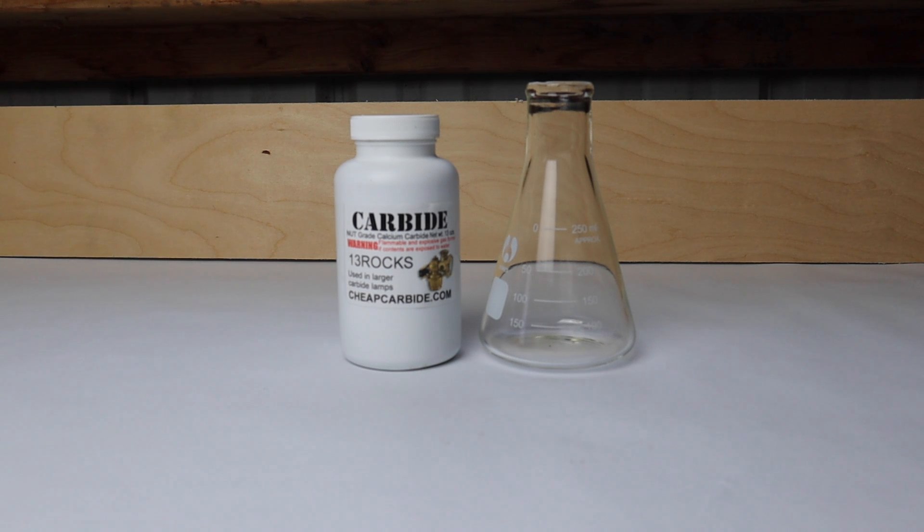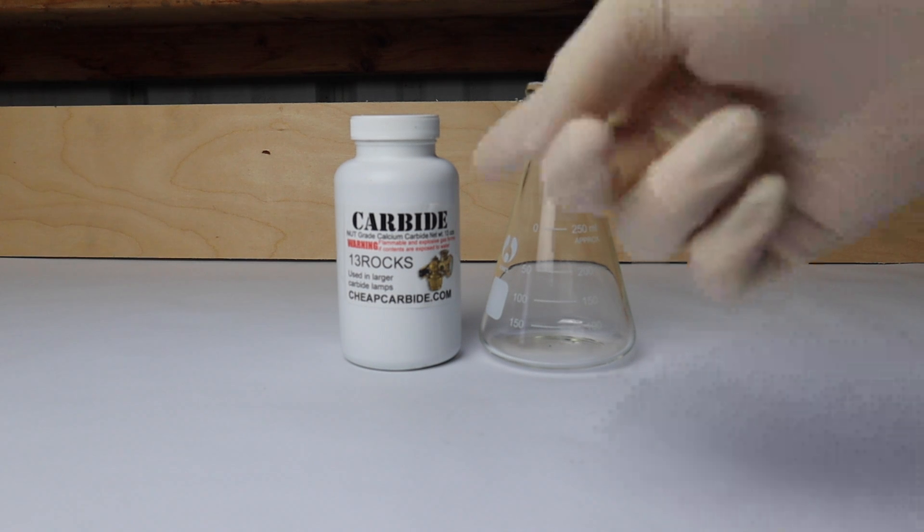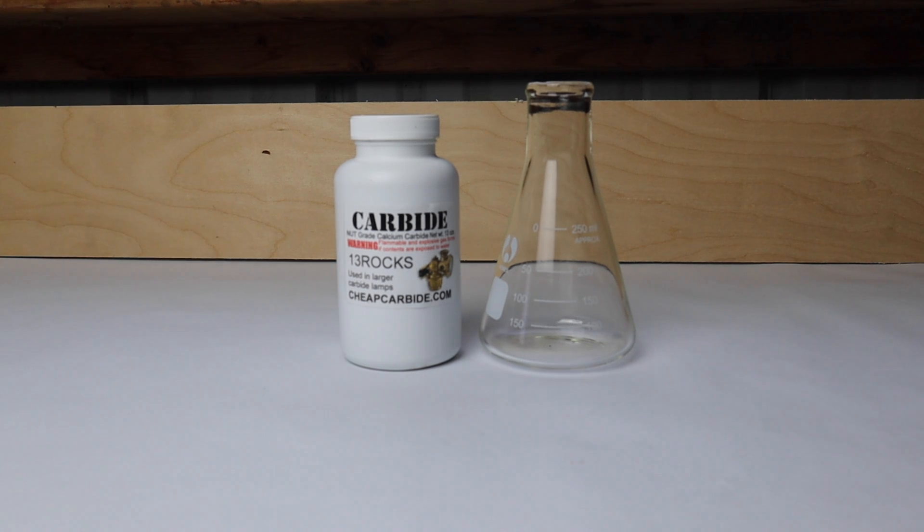Hey guys, so my chemistry professor did a pretty cool reaction where he lit ice on fire using calcium carbide. I wanted to recreate that reaction and share it with you.